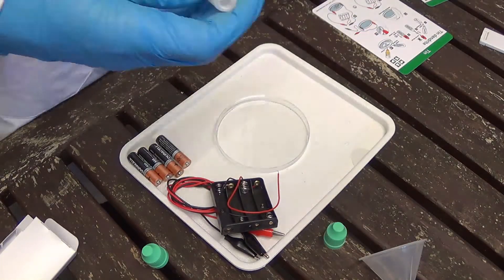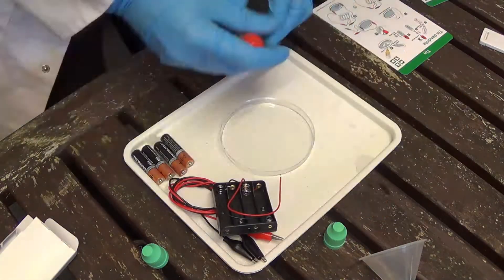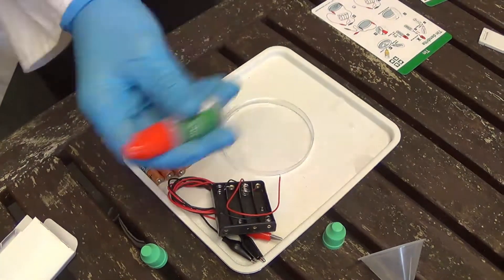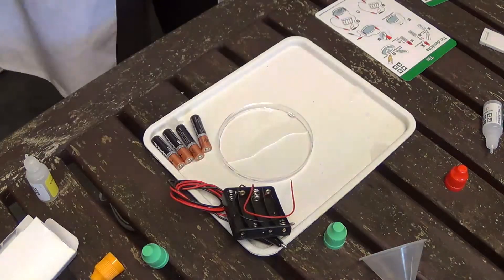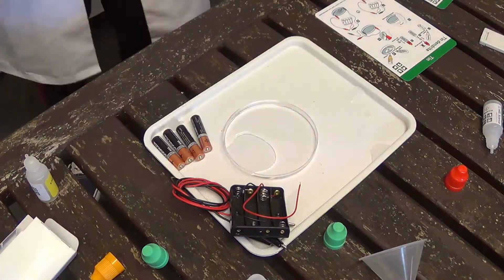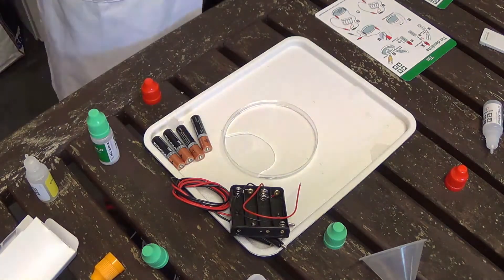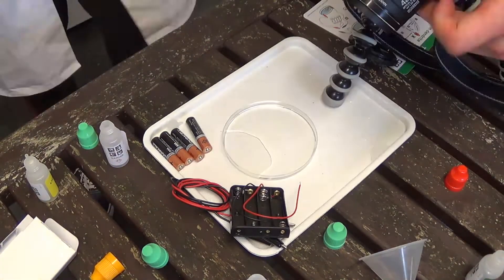This experiment is a lot like the last experiment. We take the sodium hydrogen sulphate and the tin chloride and we combine them together and shake well. Once they're in a solution, we then pour into a petri dish. We found that just one solution mix couldn't fill the petri dish and it took two and a half to actually fill it, so that's what we did.